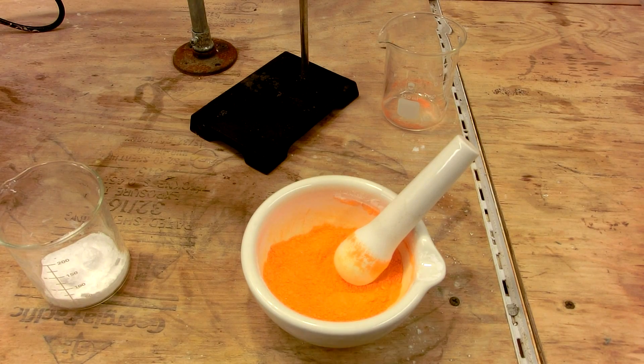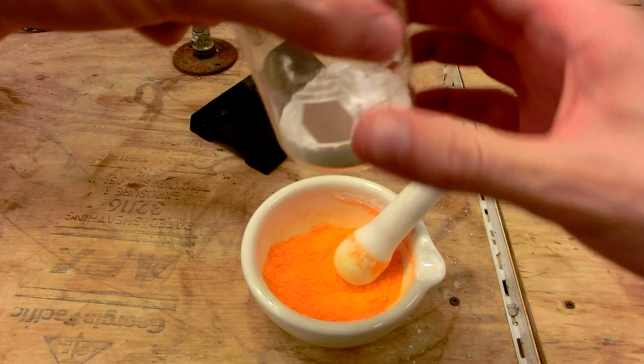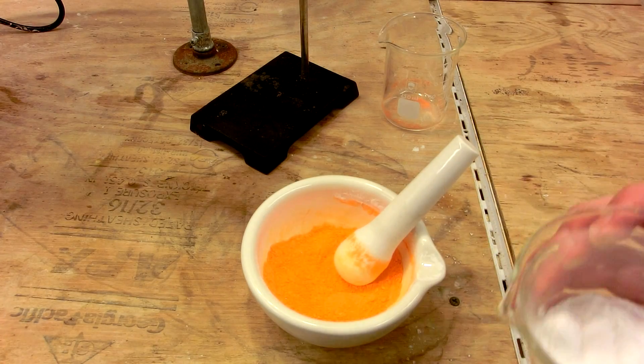Once you have both materials as a fine powder, you can combine the two together, and then grind some more until they are completely homogenized.